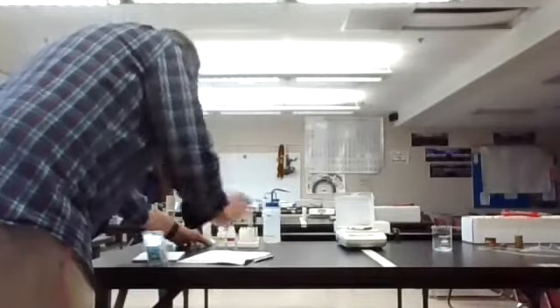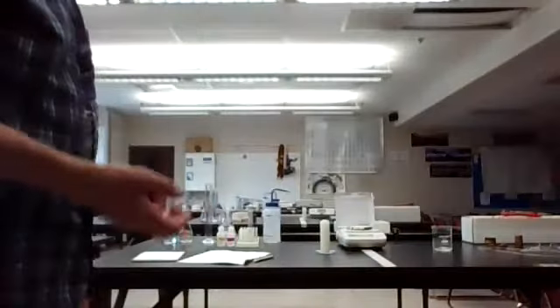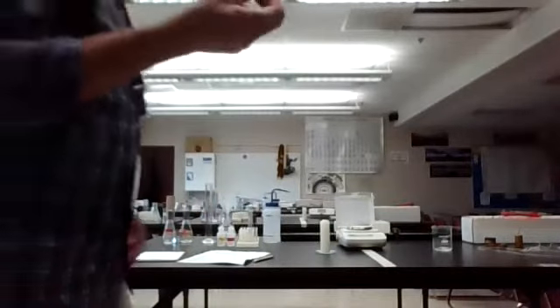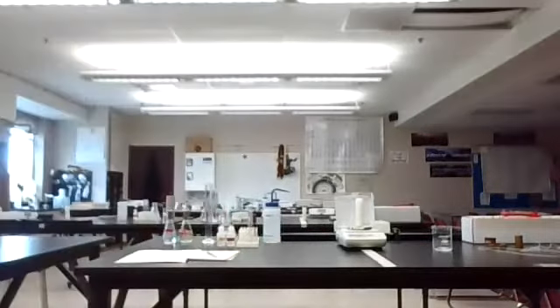Okay. Next, we're going to do this same thing with the candle. And the candle is sitting on a watch glass. Okay, I have to turn the balance on. What we're going to do then is light the candle, let the candle burn for a while, and mass it a second time. So I'm going to go ahead and set it under and zero it out for us. Our mass of the candle and the watch glass is 101.43 grams.